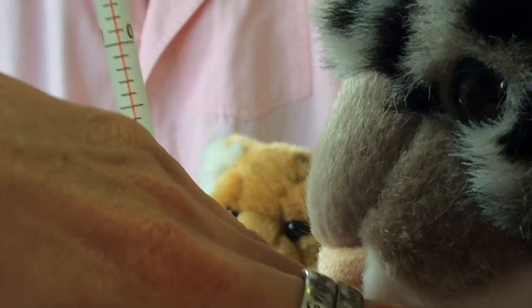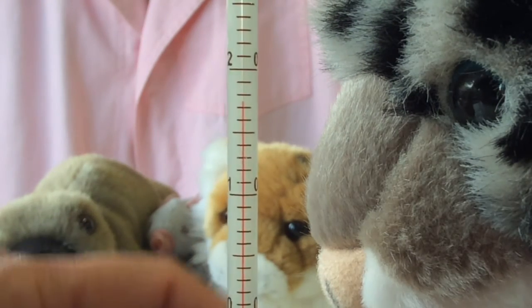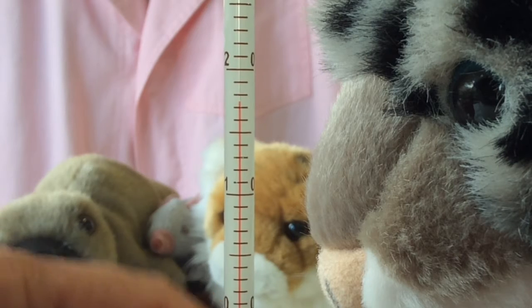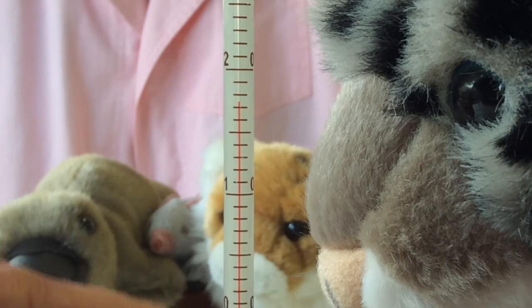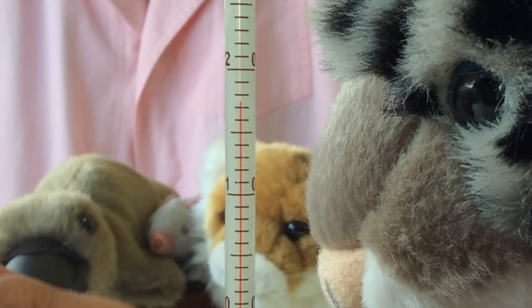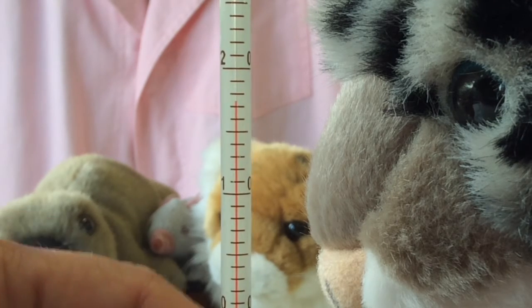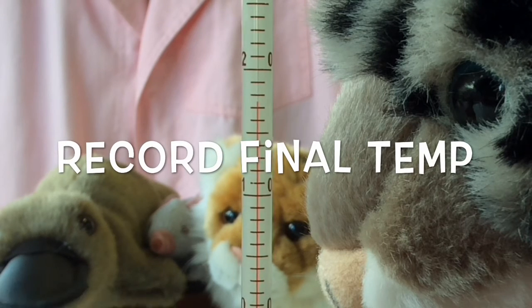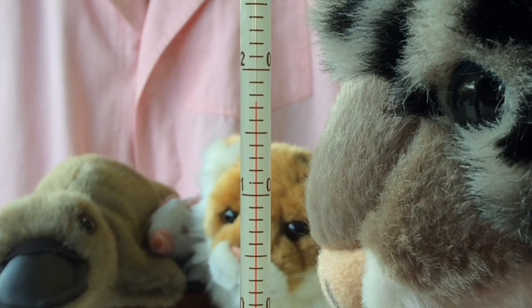All right, let's get that going. Let's stir so we can have a uniform temperature in the calorimeter. Are we noticing anything? That's it, girls. Wasn't a huge change. Might as well record that temperature now.